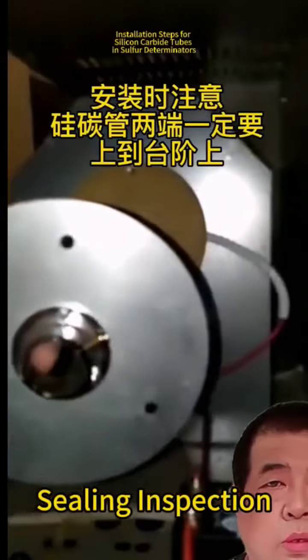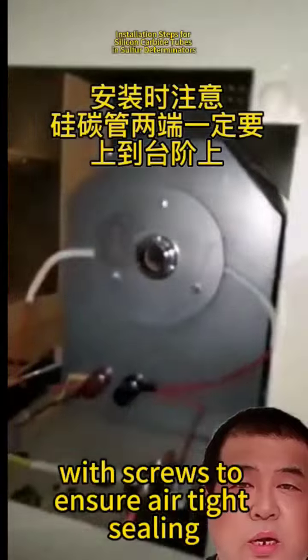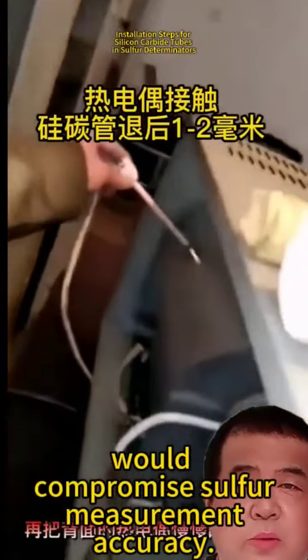Sealing inspection. Close and fasten the furnace chamber cover plate with screws to ensure airtight sealing, which prevents gas leakage during testing that would compromise sulfur measurement accuracy.